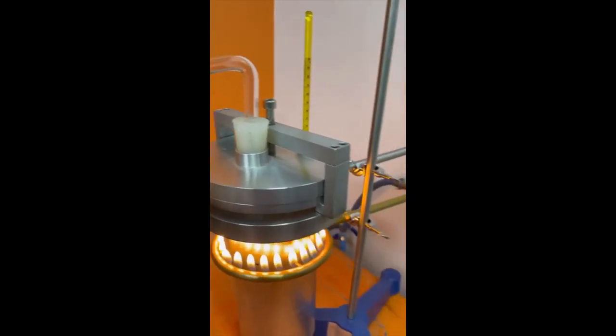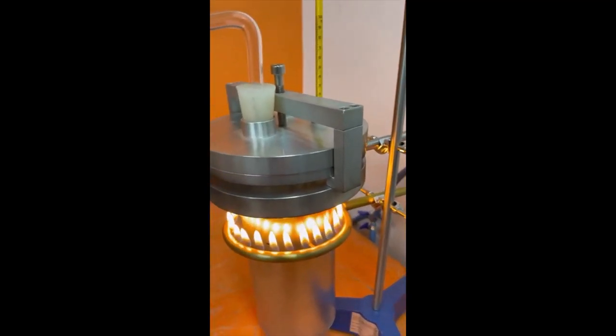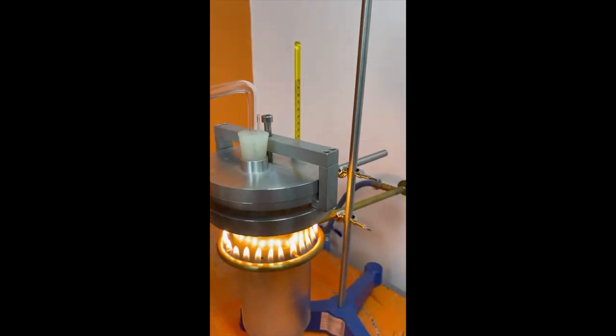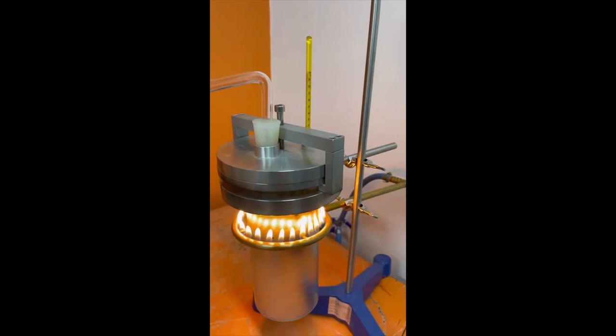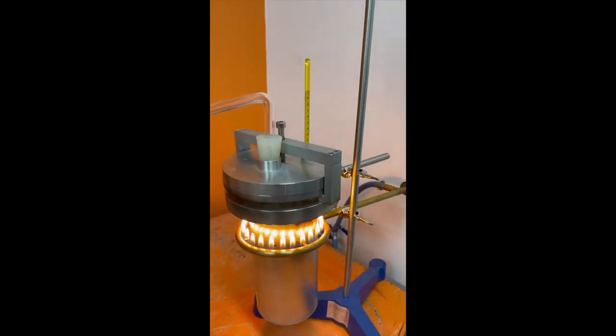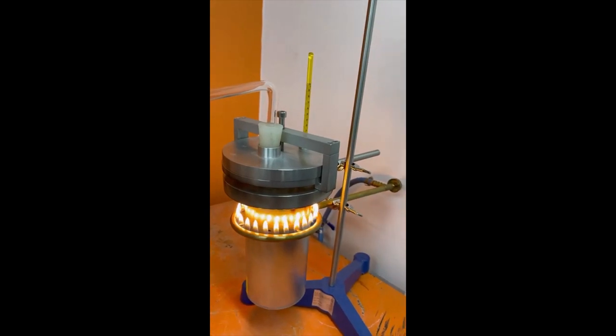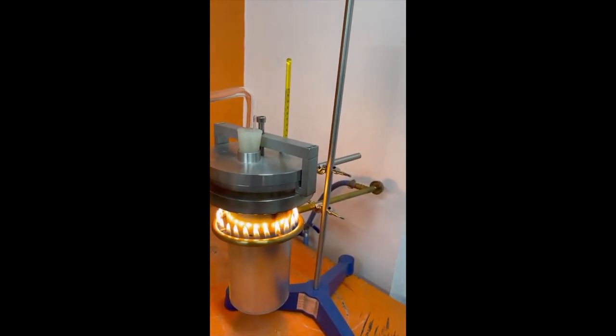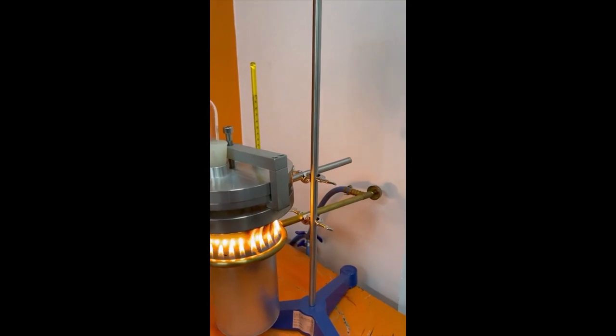We will wait to reach 260. After we reach 260 degrees, we will wait for 15 minutes and we will check the volume.